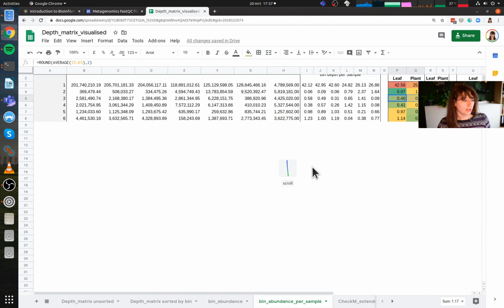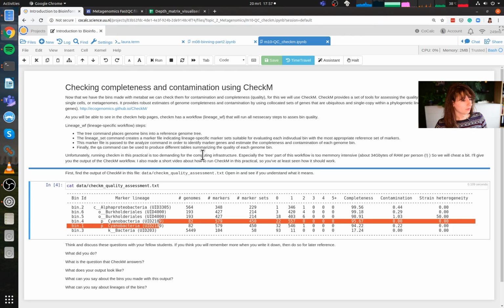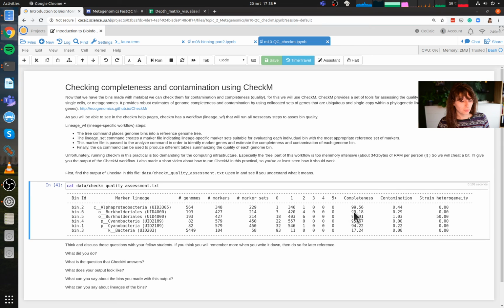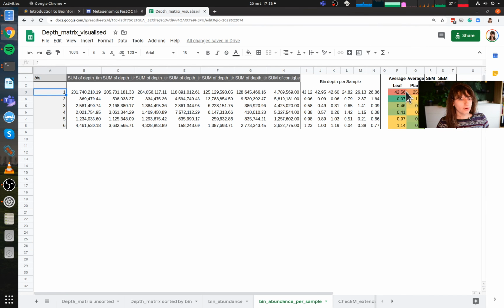So what's also nice, so let's see. There were two, where am I? Yep. So two cyanobacteria, that's funny. So bin 1 and bin 4 are two cyanobacteria, both with a high quality. So let's look at where these bins are. Bin 1 is this super abundant bin over here.